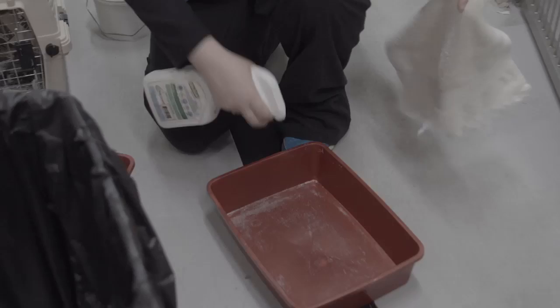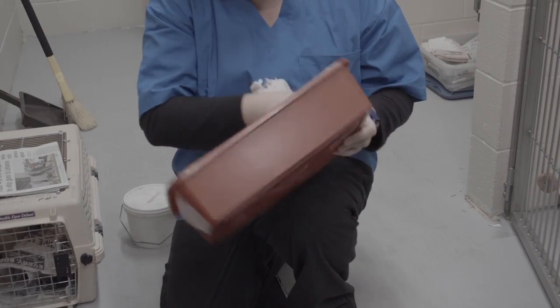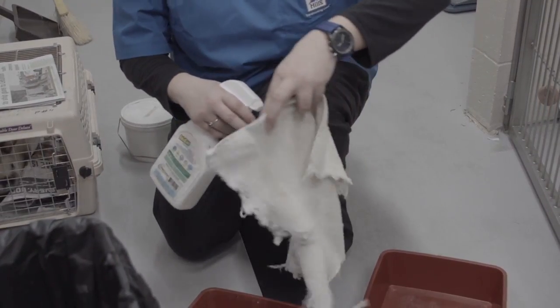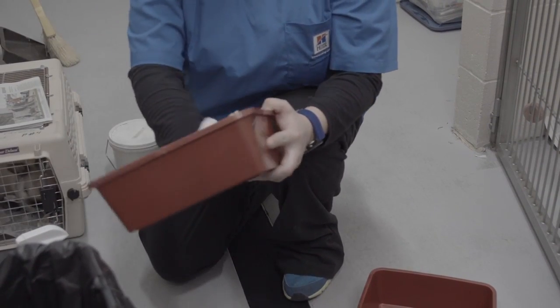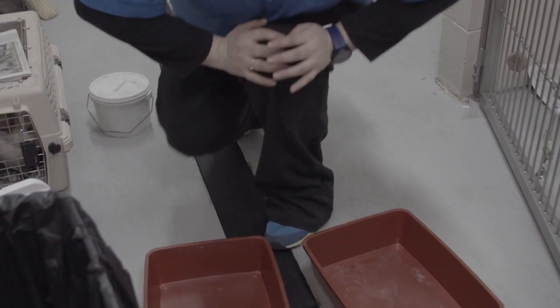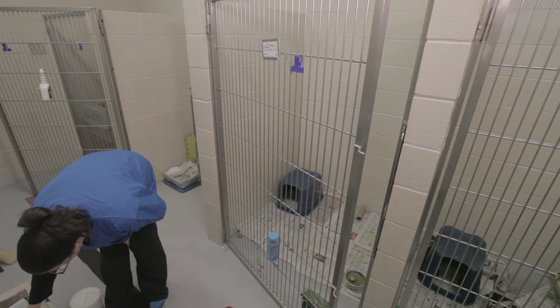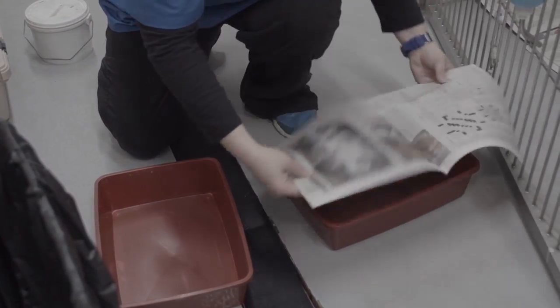Now when you're spot cleaning your litter boxes, you just spray it, wipe it out — and the play box too — or you can spray the rag. Now we line those with paper.